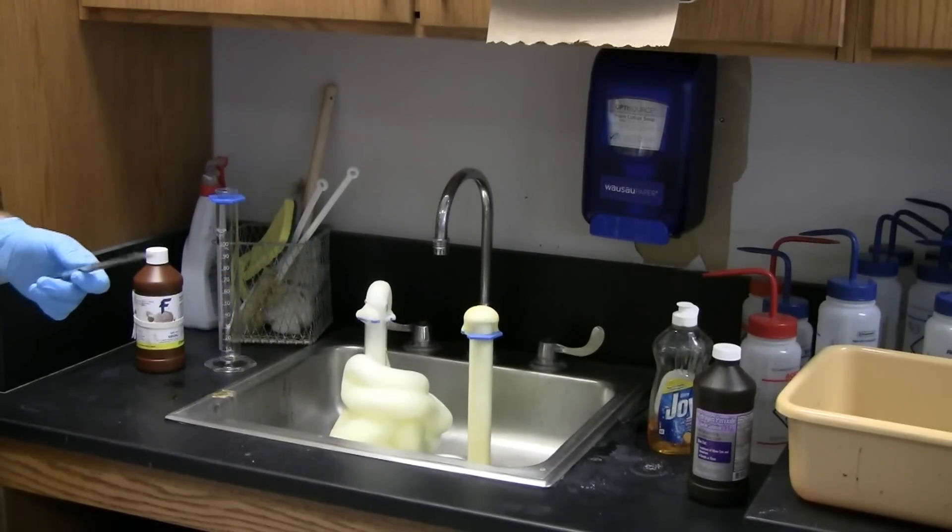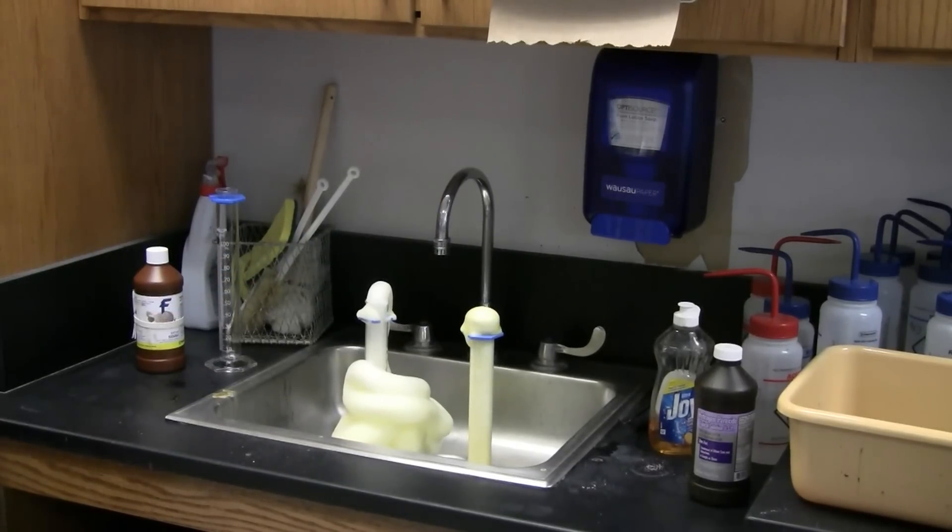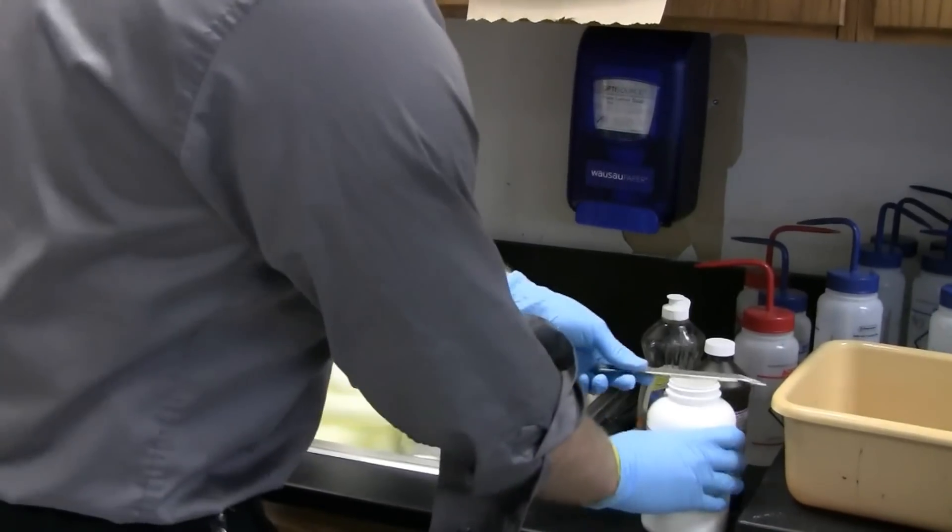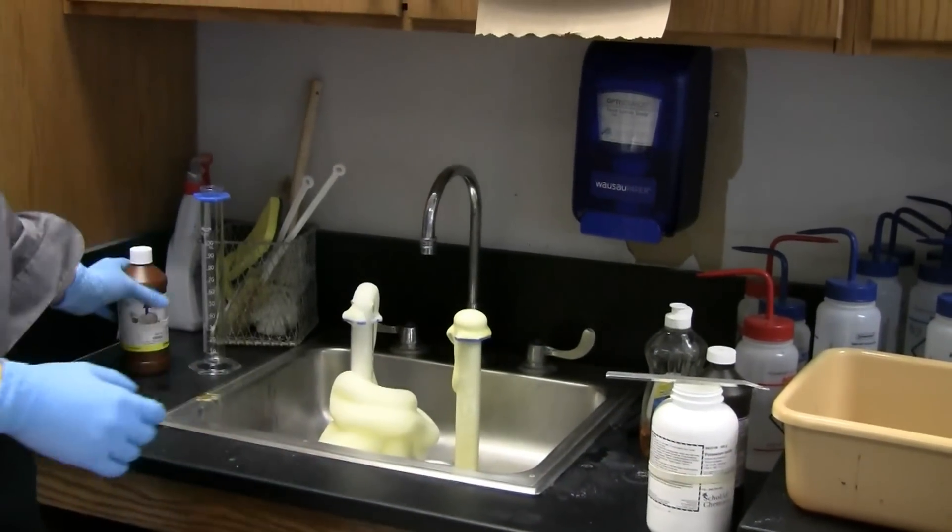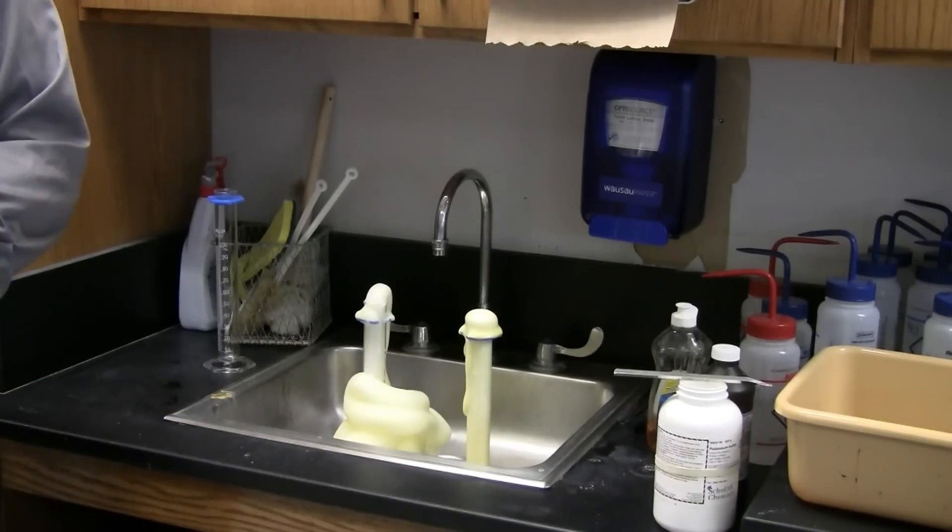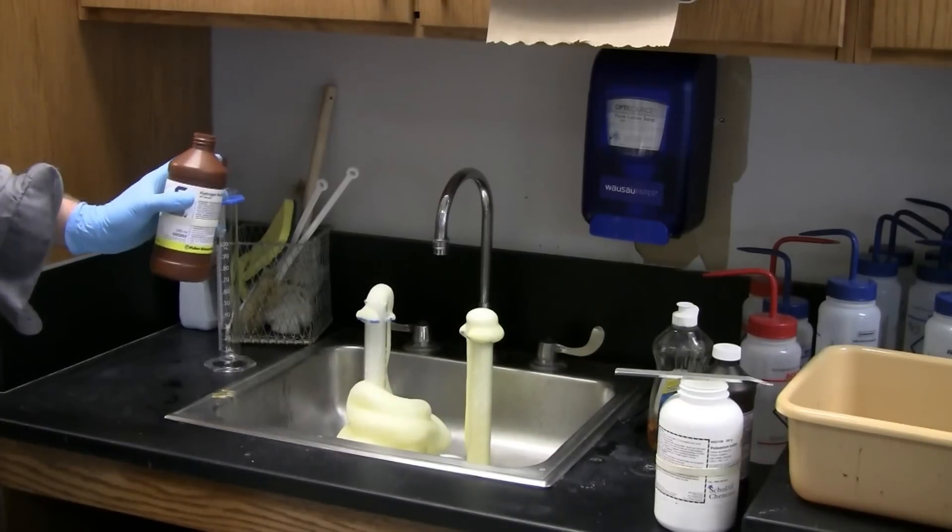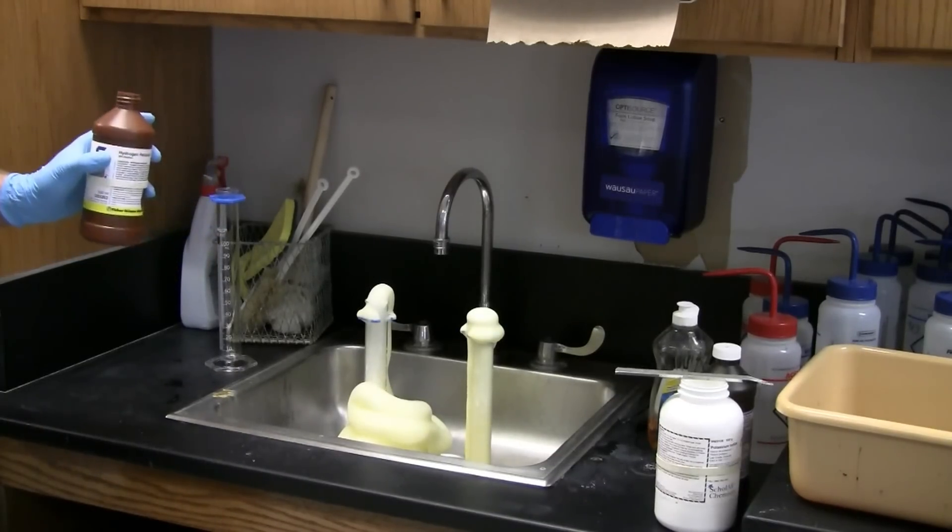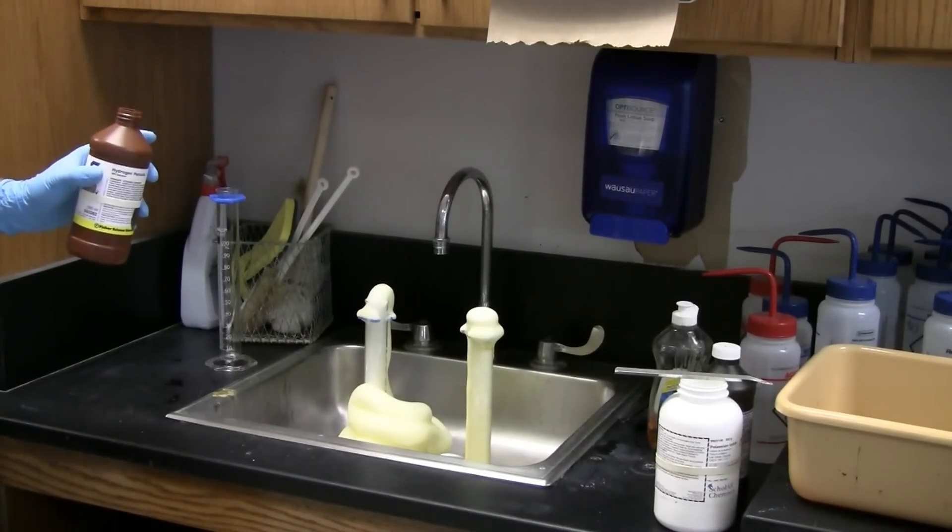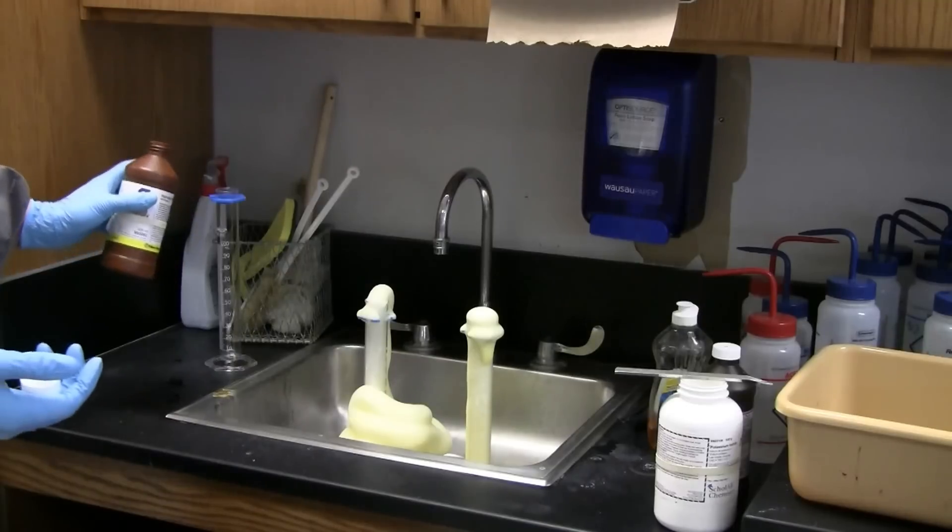Oh, that one's oozing out too. Dude, that was... Oh, my God! Can you imagine, like, a whole thing like that? Just, like, fill a pool. Look at that! That would be horrifying. Your whole house would just fill a pool. Like, if you put a swimming pool filled with hydrogen peroxide, and then you dumped in a catalyst. This swimming pool would be awful.